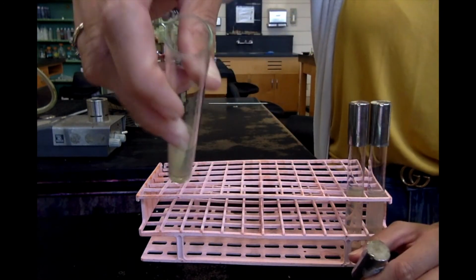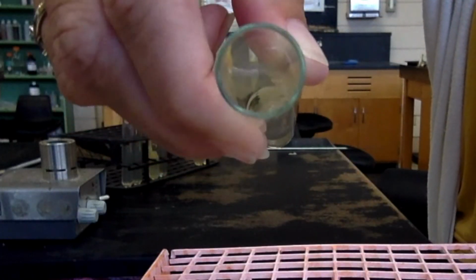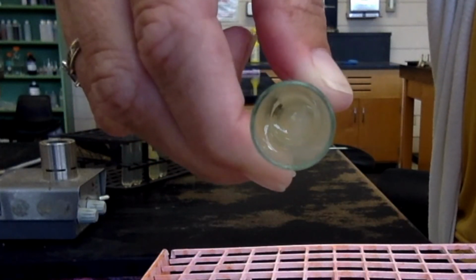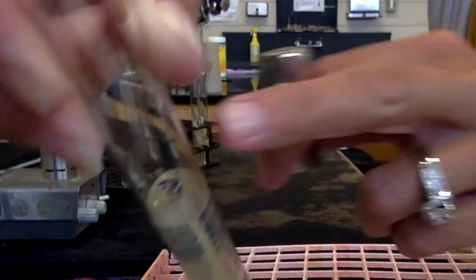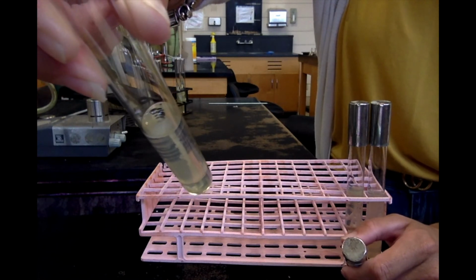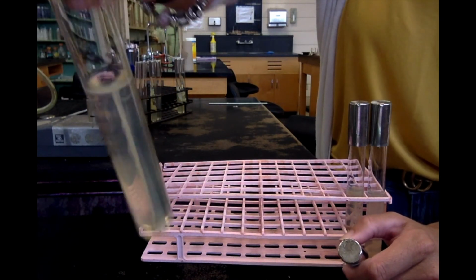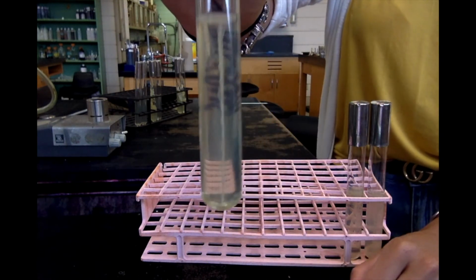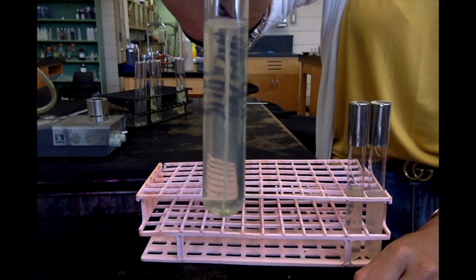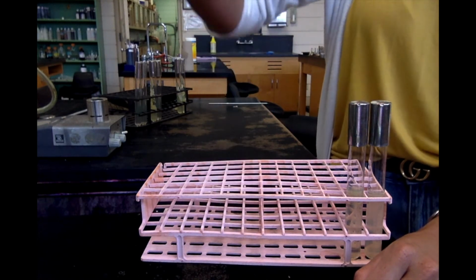Also, you can take the top off and look down in the center. It's kind of hard to see here, but there's a dot right in the center where the bacteria is growing. So it didn't move away. It might be easier to look at here. You can see it's right in the center, but it's not going side to side. Okay, so if you were to do an unknown and you saw this result, this would be facultative non-motile.